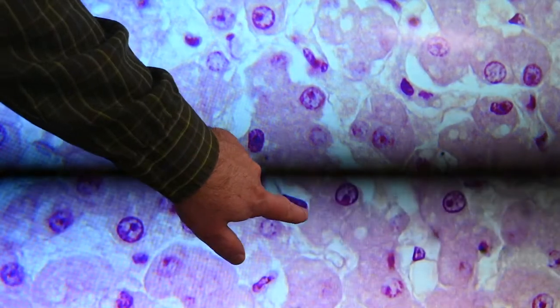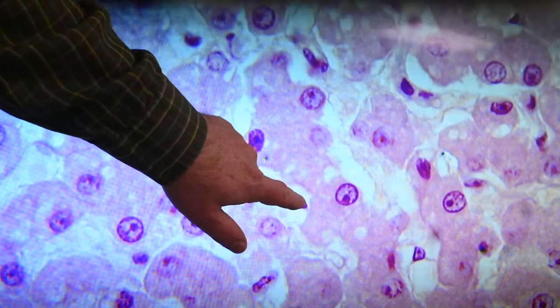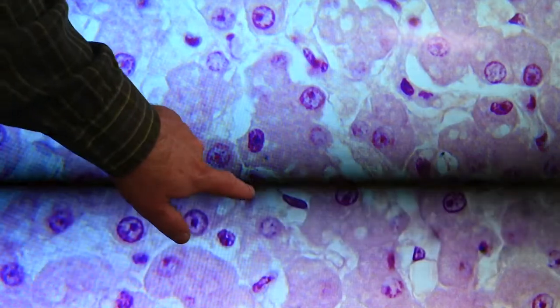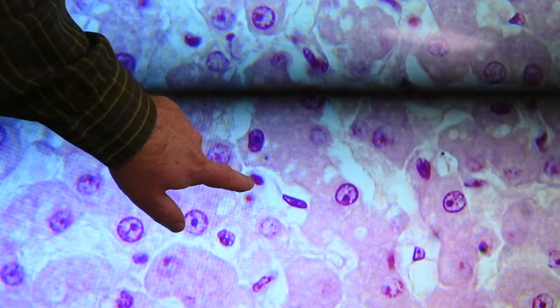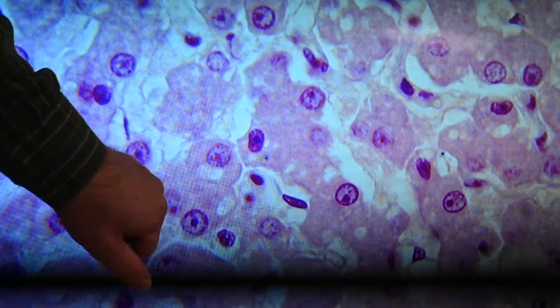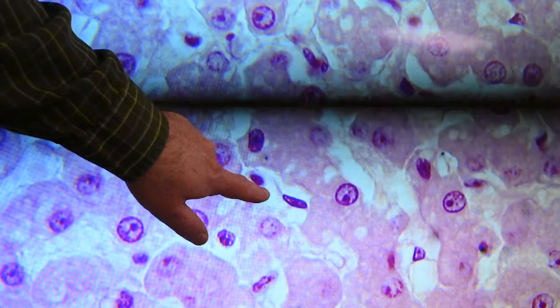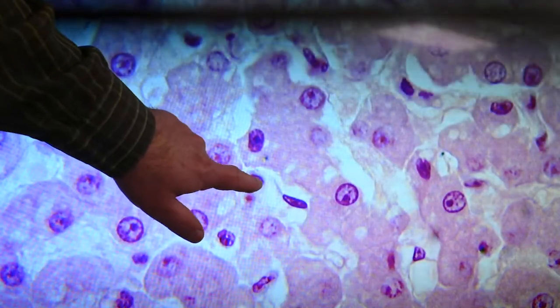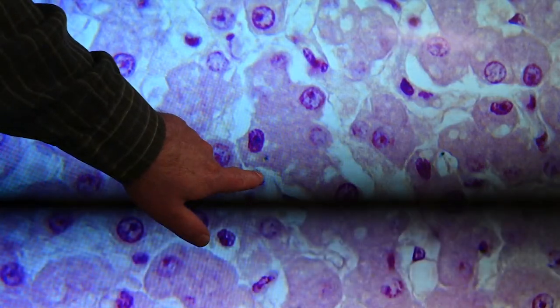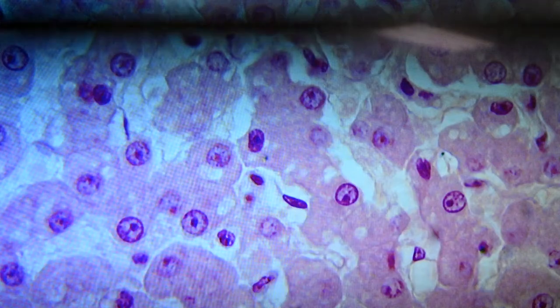There's an endothelial cell right here, and that space between the endothelial nucleus and the hepatocyte, that white space, would be space of Disse. This, I'm not sure if that's a Kupffer cell or not. It's kind of a small nucleus, but there's a shadow of cytoplasm around it. I wouldn't use that as an example, but possible Kupffer cell in this sinusoid. This would be sinusoid space, and so that white space above that, still space of Disse in there next to the hepatocytes.